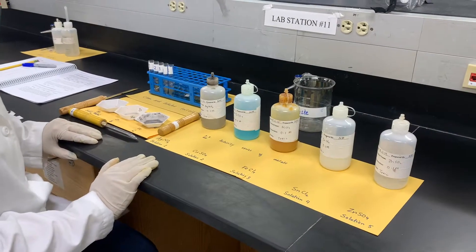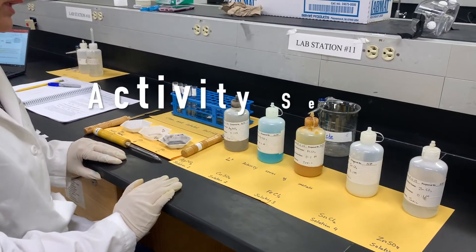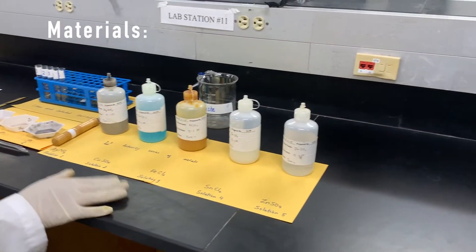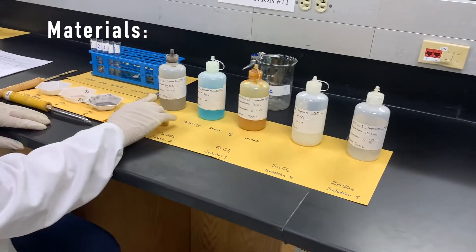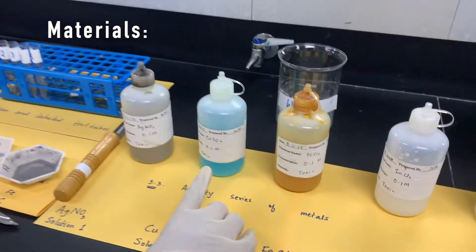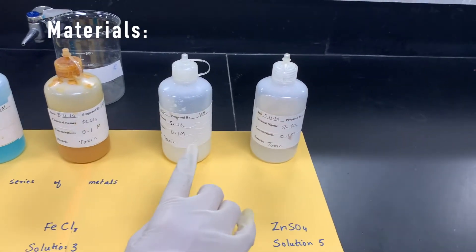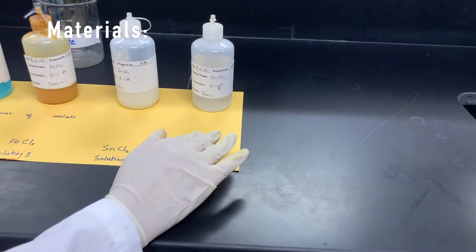Now I'm going to do part three, that is the activity series of metals. For this part we need five solutions. Solution one is silver nitrate. Solution two is copper sulfate. Solution three is iron chloride. Solution four is tin chloride, and solution five is zinc sulfate.